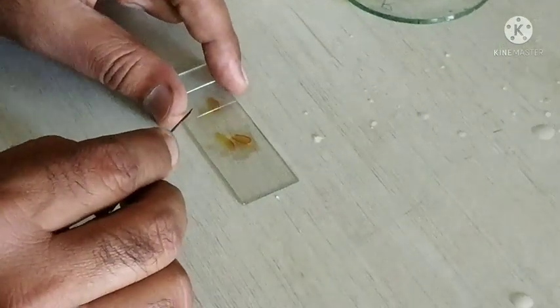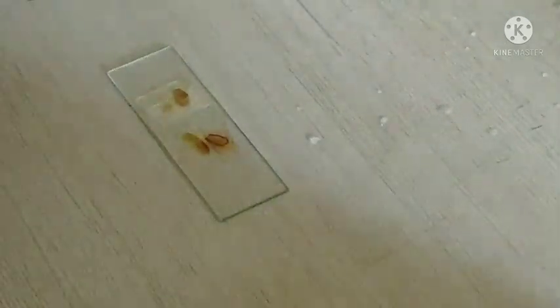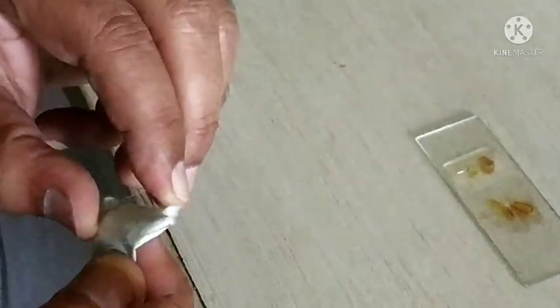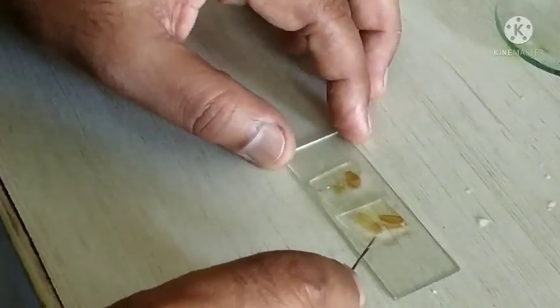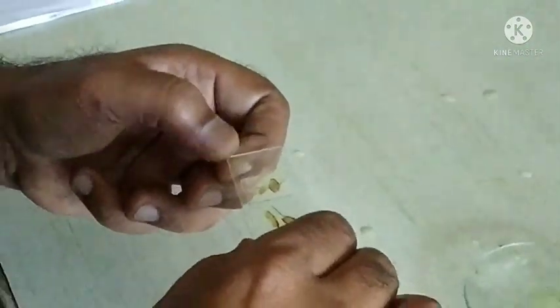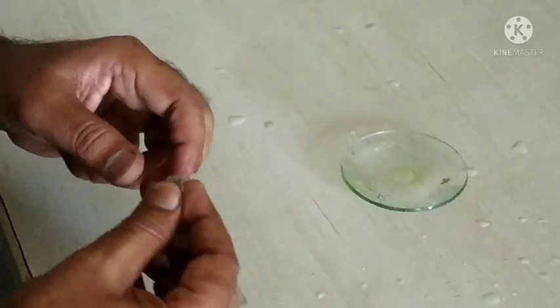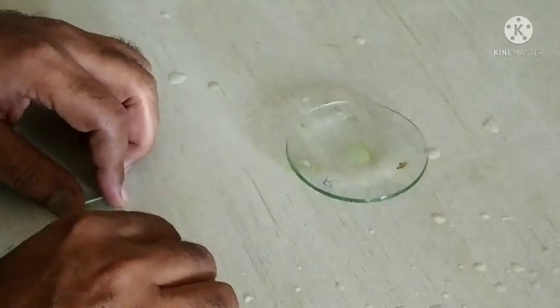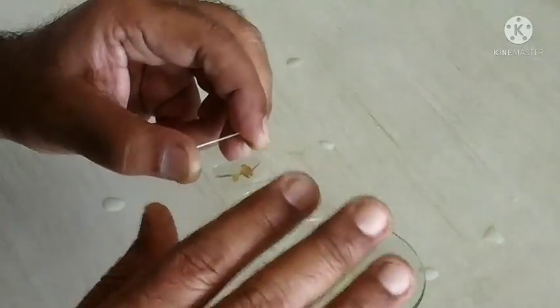With the help of a dissecting needle, place a clean cover slip on the sections, which prevents air bubbles from entering the section. Then after placing the cover slip, clean the slide with wiping paper and observe the slide under the microscope. This completes the cutting technique, staining technique, and mounting technique for Nux vomica seeds. Thank you.